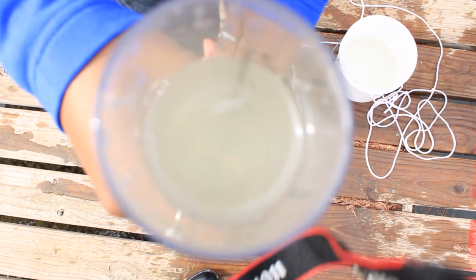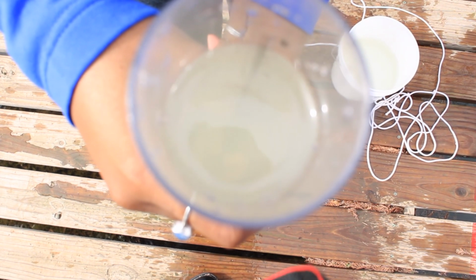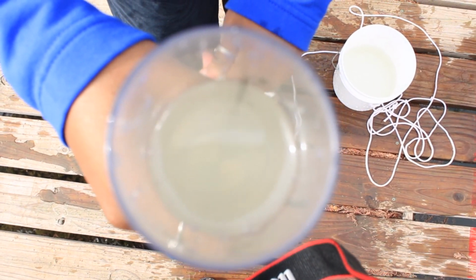If the tube is filled to the top and the disc is completely visible, record the measurement as greater than the transparency tube maximum measurement.